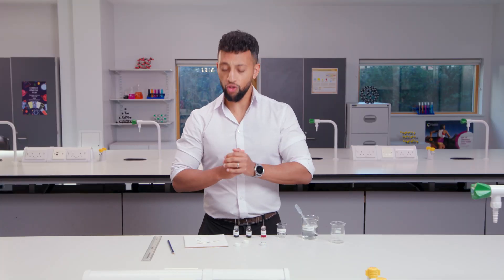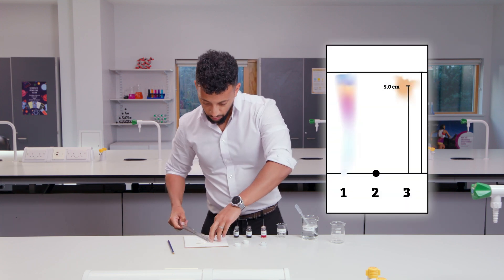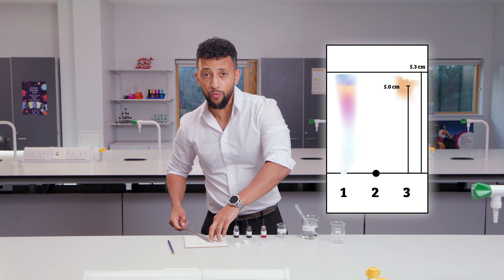I also need to know the distance from the solvent front to the origin line. This is 5.3 centimetres.